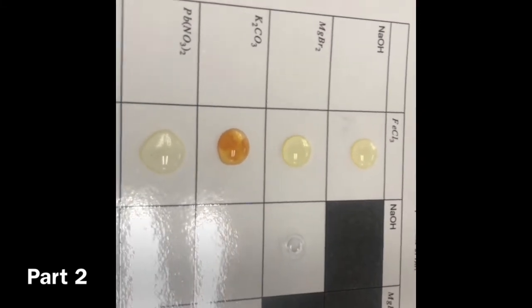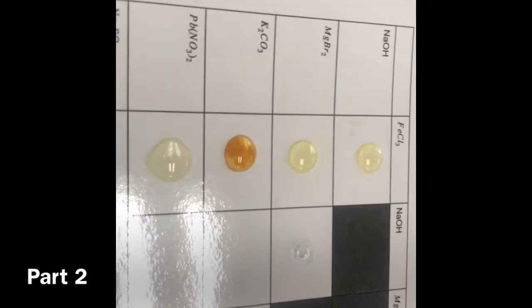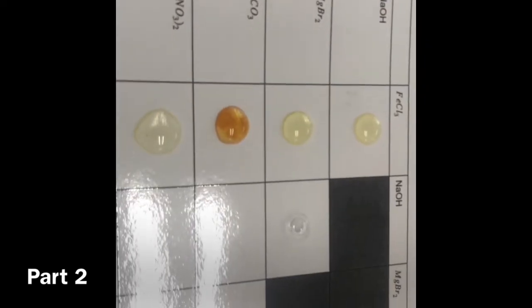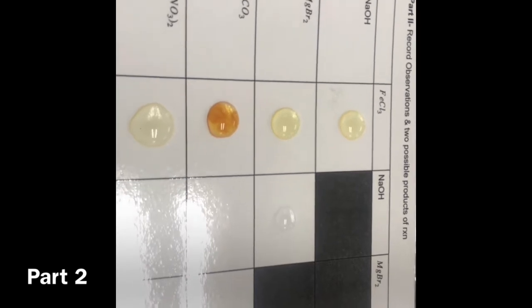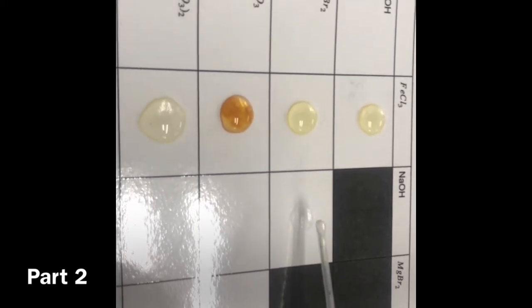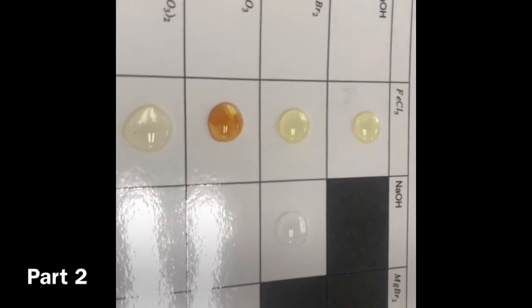Anyway, which one did we take from those? It was the magnesium one. MgBr2. Oh yeah, that's the magnesium one. I was holding it. Alright, two clear substances. Will they react? Probably not. You wrote down all the stuff here, and if you want to right now, you can also write down what the reactants were. Alright, looks like there was no change on that one.